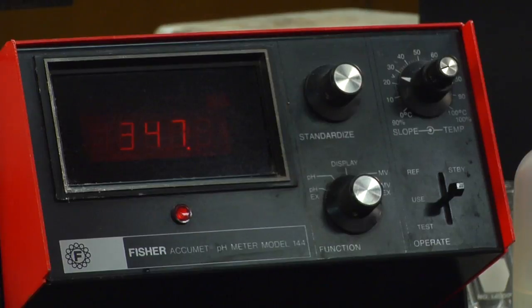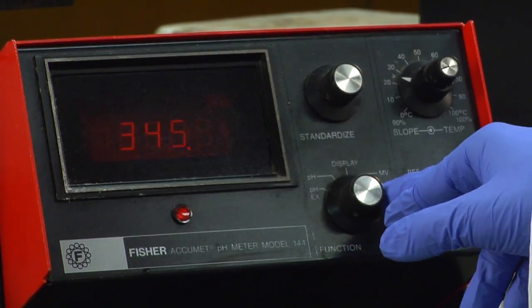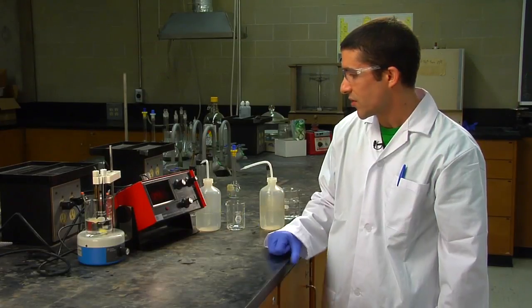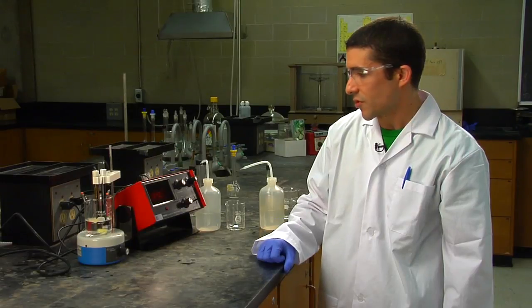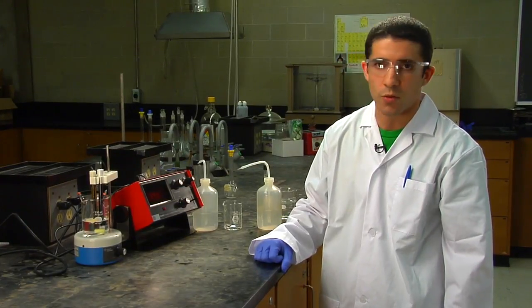And then you can see on the display screen it's now measuring a potential. Just make sure that the dial is set to read potential in millivolts. Typically the potential will give you a stable reading fairly quickly, you may have to wait a few seconds.